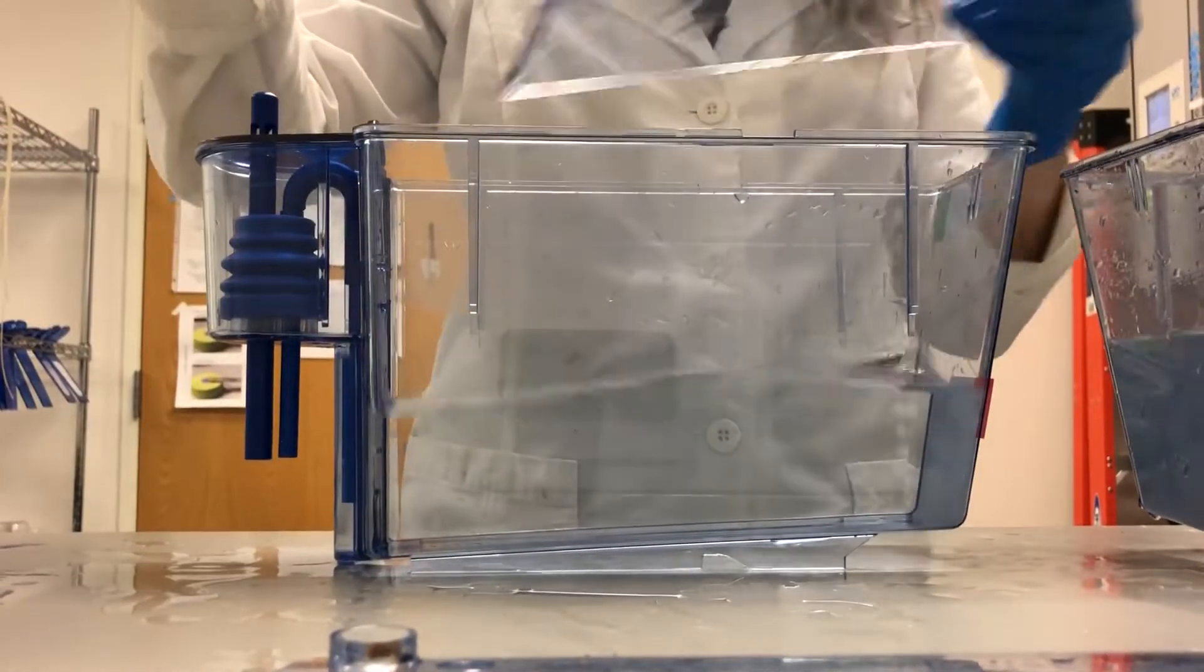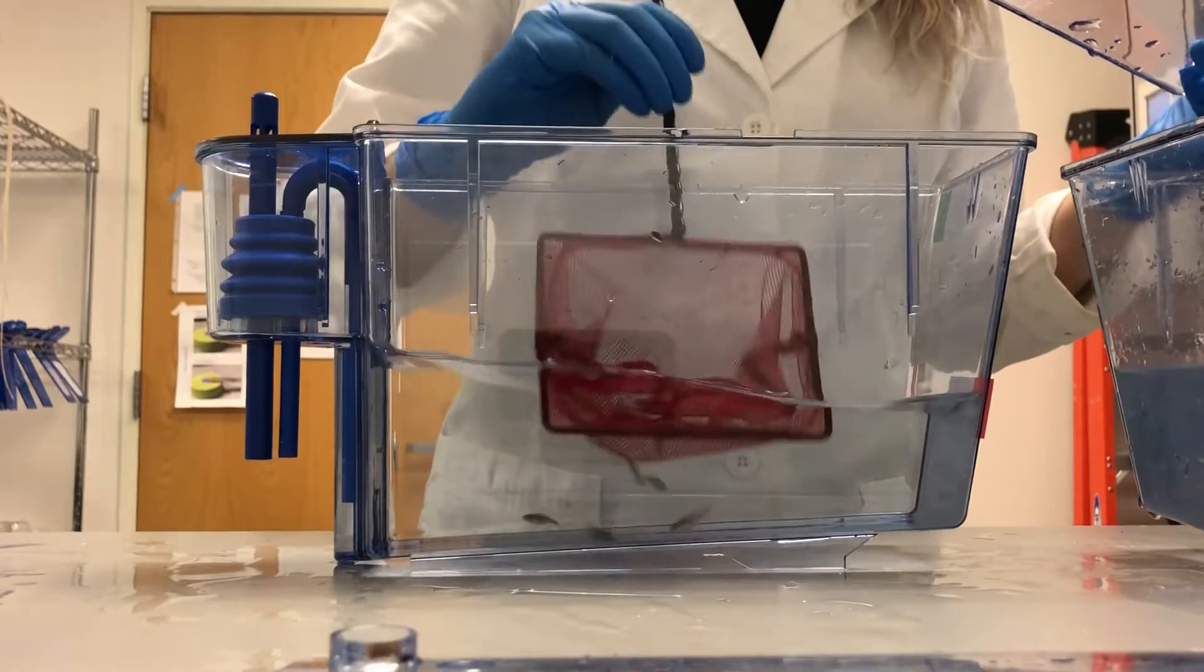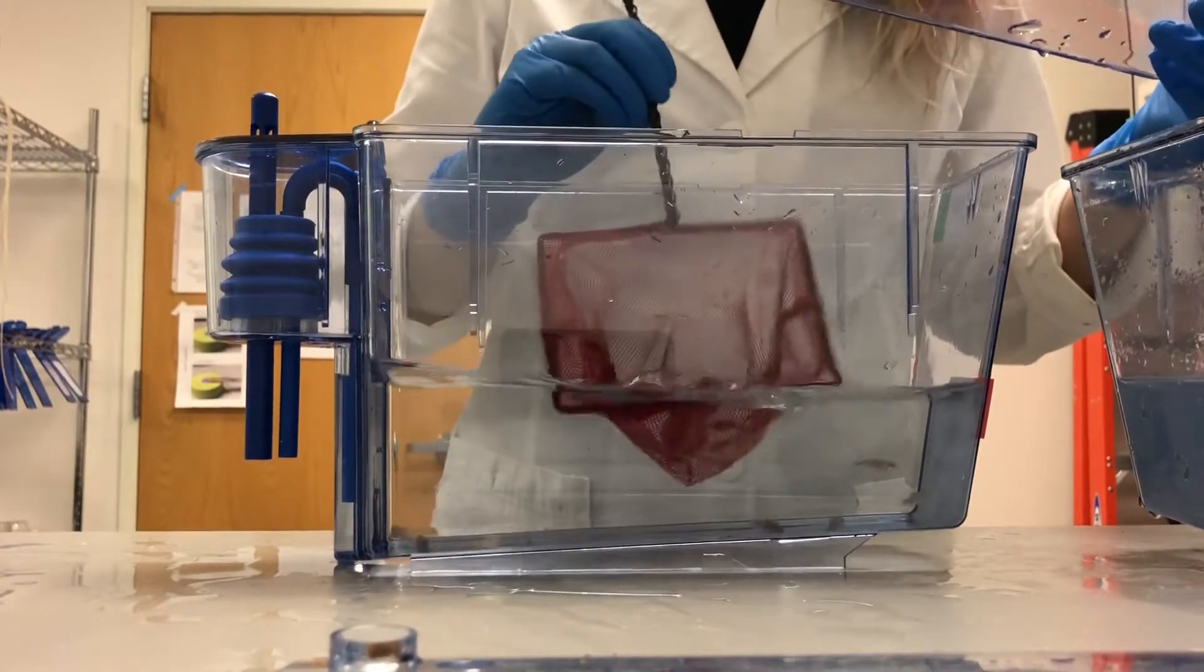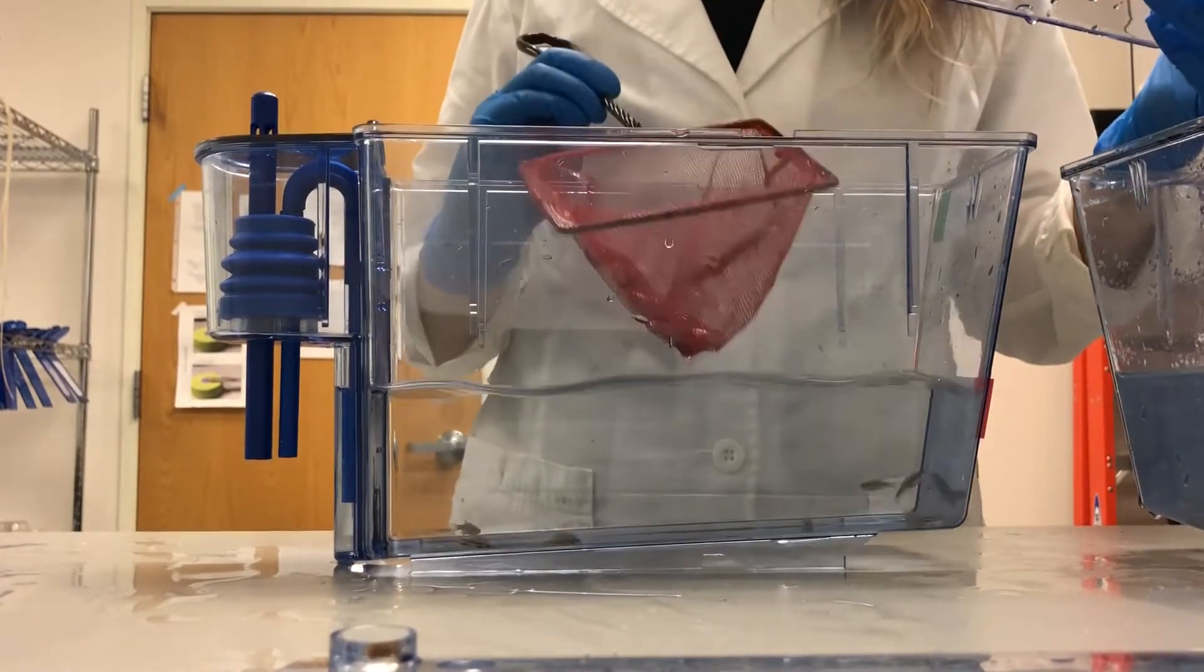Be sure to replace the lid on the tanks after you're done handling the fish because they will try to jump out and we don't want to lose any fish.